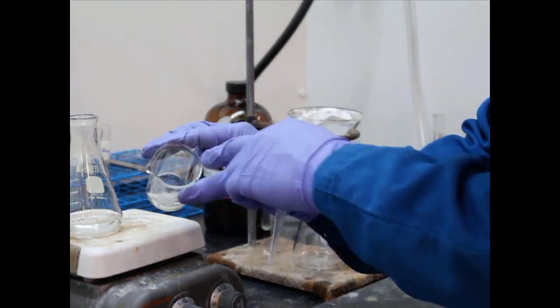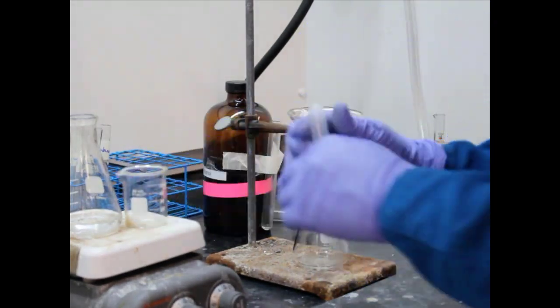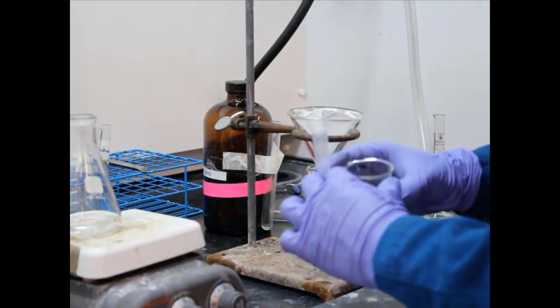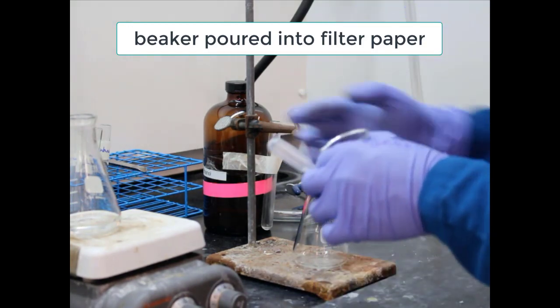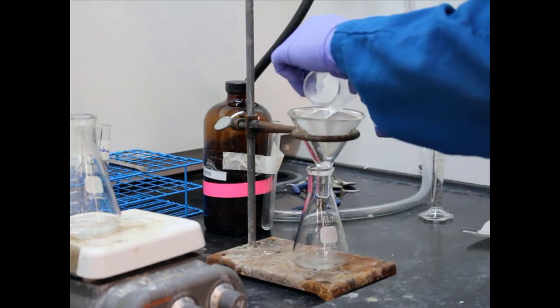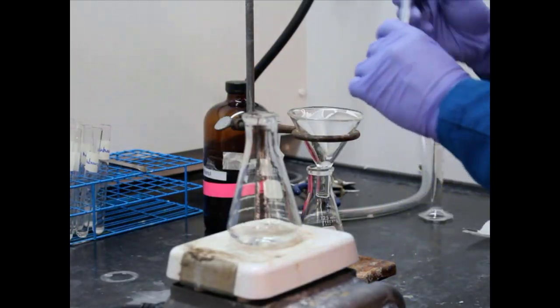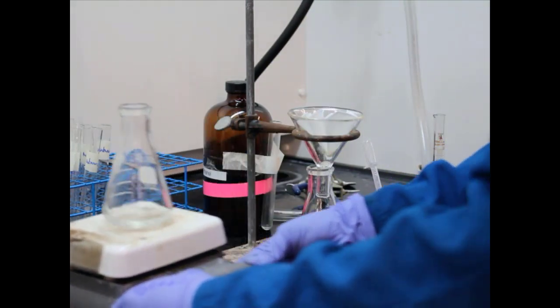All right. So now they're going to take their hot solution that has dissolved unknown in it and some solid impurities. All right, they poured it through, and now they're going to add some hot ethanol into it to try and catch anything that was left over. All right, they're going to do this a few times. All right, just rinsing the beaker with hot ethanol.